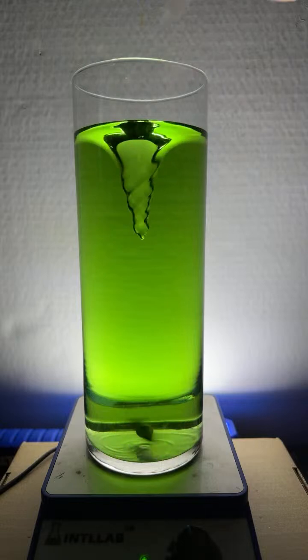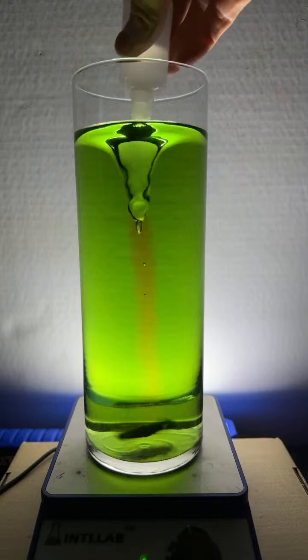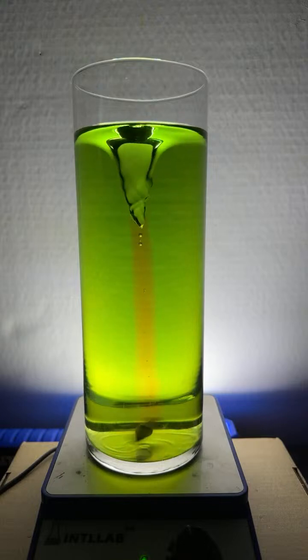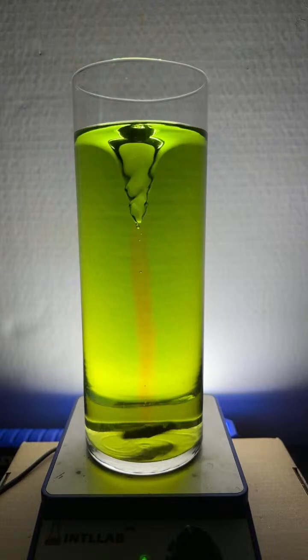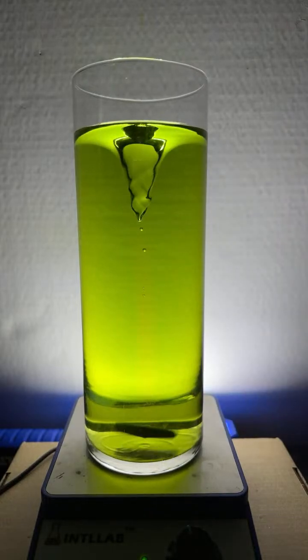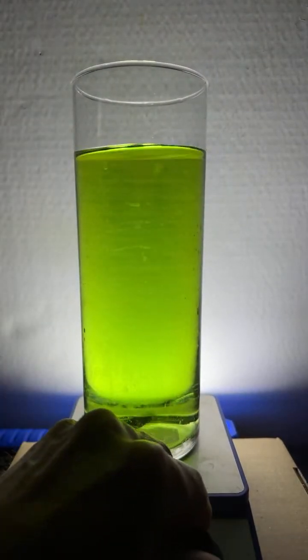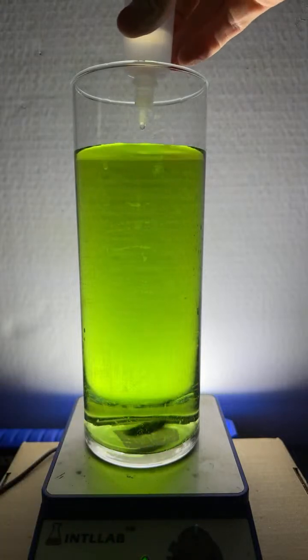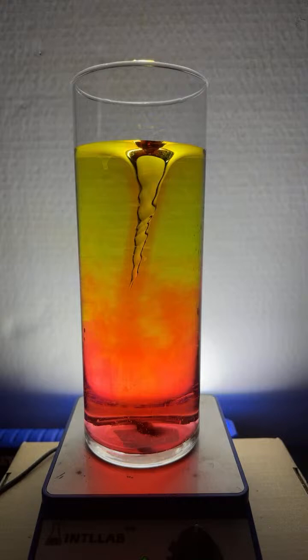Here, I'll show you. I'll try it with some acid. So this should turn it red, and it will in the middle, because there's a high concentration of acid in the middle. I'll add a few more drops, like 5 drops of this stuff. And again, in the middle, you see the red, but because the solution is buffered, the pH doesn't change a whole lot, so the color doesn't change a whole lot once the acid mixes through the whole solution. That's in contrast with this one. If I add a whole bunch of base or acid to this one, the color changes dramatically. So this is an unbuffered solution.